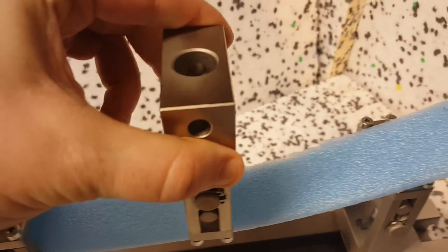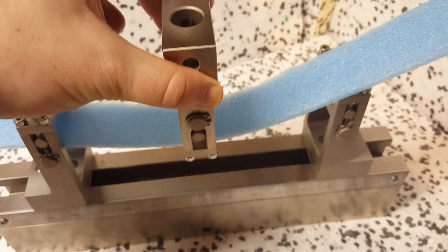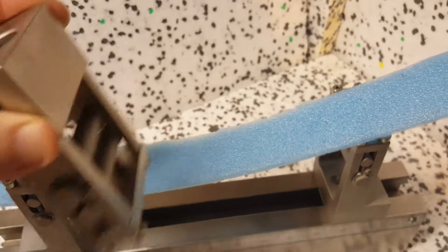Then mount it onto your machine. The idea of this test is that it's a fatigue test, so the machine is going up and down while the sample is mounted in there.